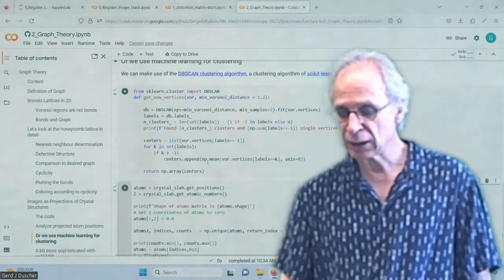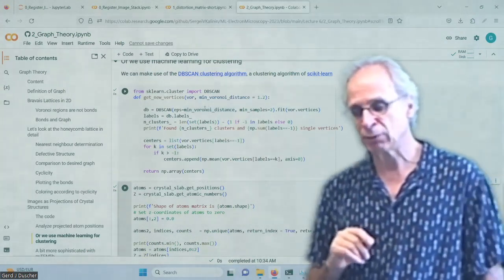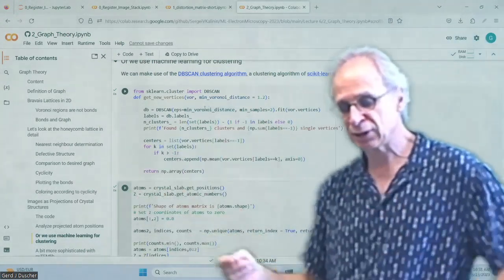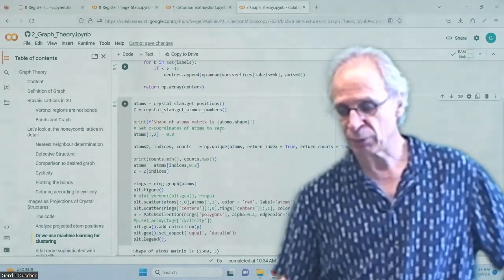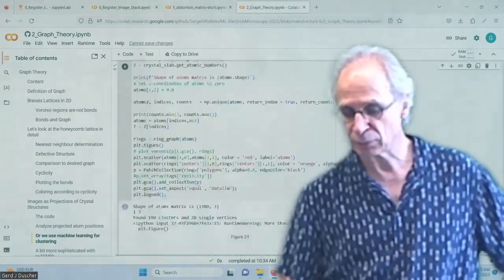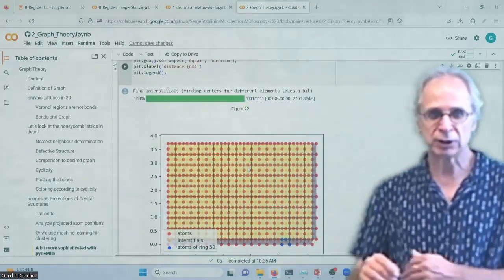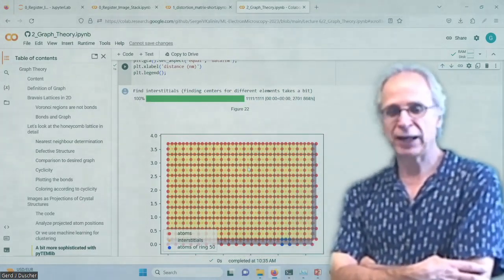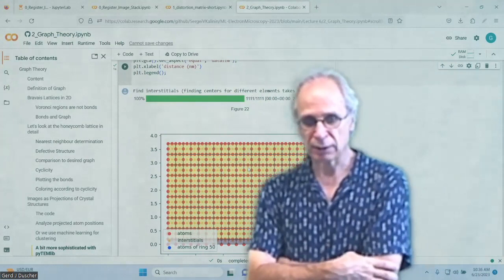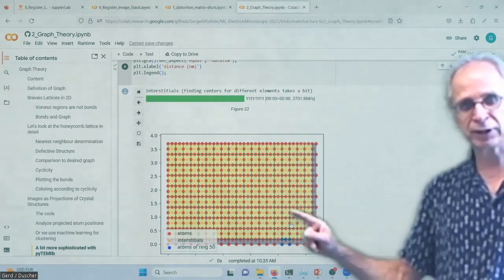And I really use it only as a vague input now, instead of a hard input of how close they should be. The minimum sampling size is 2, so everything else is a single one, and I'm using Z to determine that as well. The other ones are averaged. Okay, so sorted in clusters. And of course, if you do it a little bit more sophisticated, as in the pyTEMlib, then you get this one here, and you can see the only difference is that I can go all the way out to the edges, and I get my rings very, very accurately.